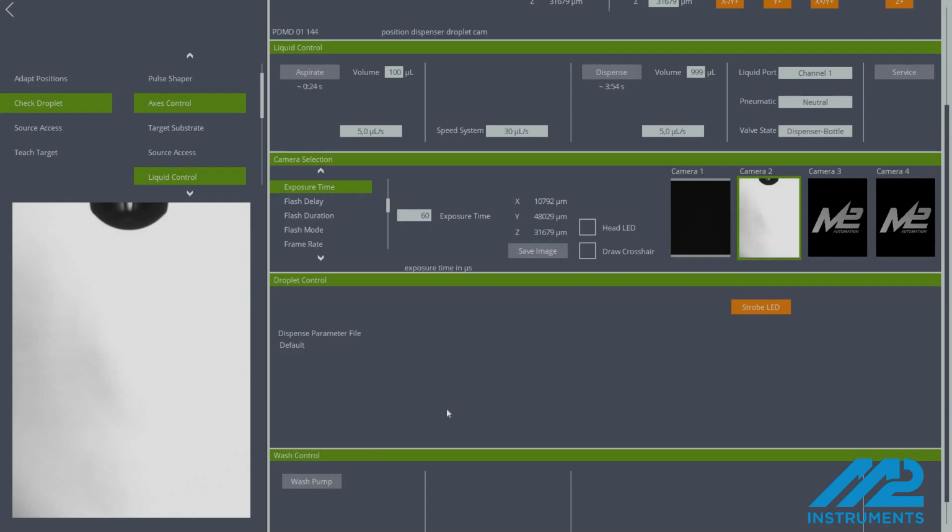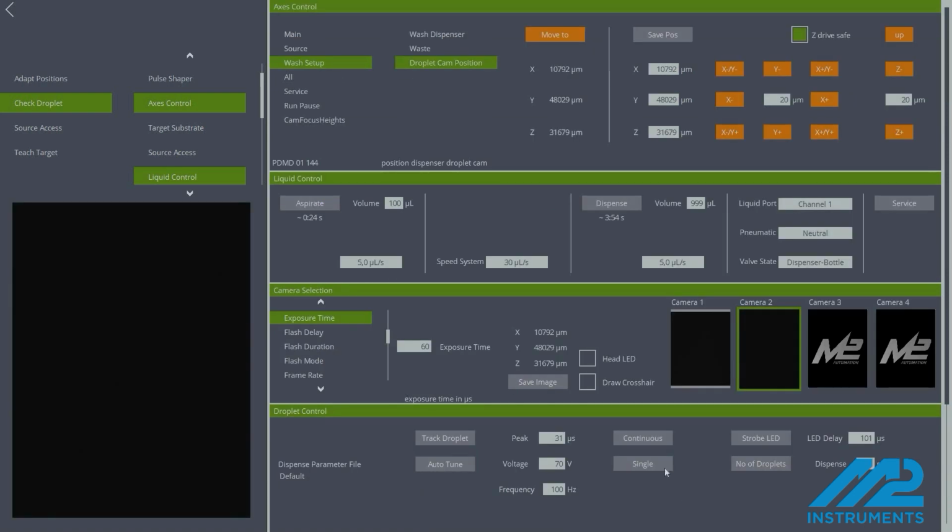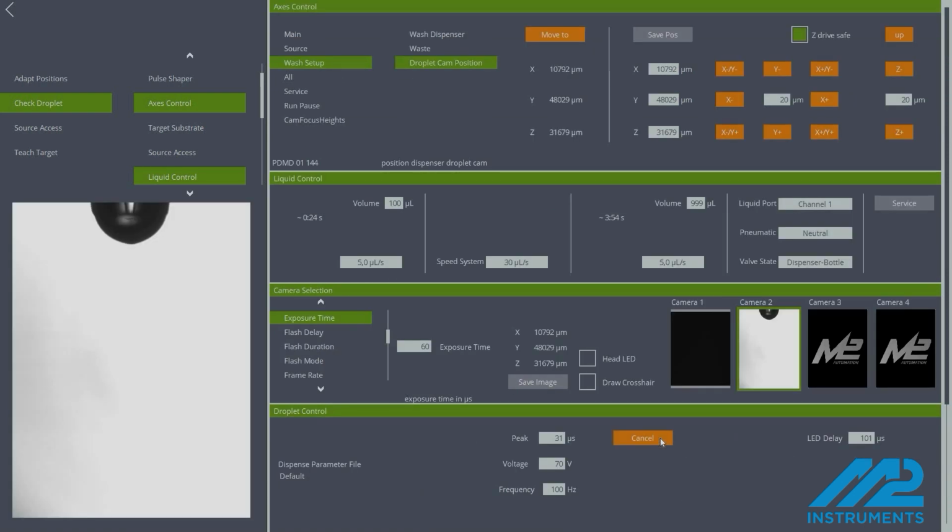To remove the hanging droplet at the nozzle inlet, the dispenser is immersed in a washing solution. Dispensing through a hanging droplet is not possible. Wait until the hanging droplet has retracted and completely cleared from the nozzle entry.